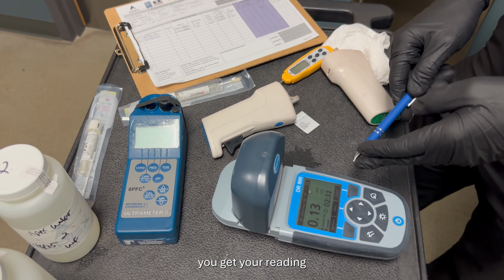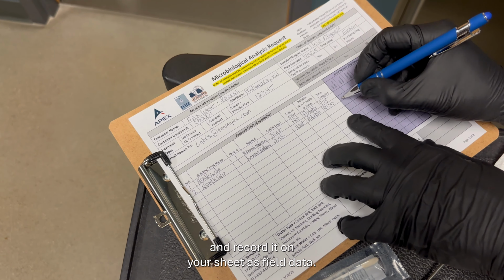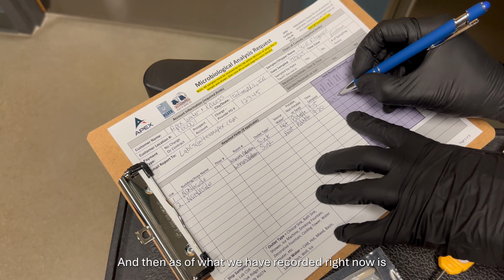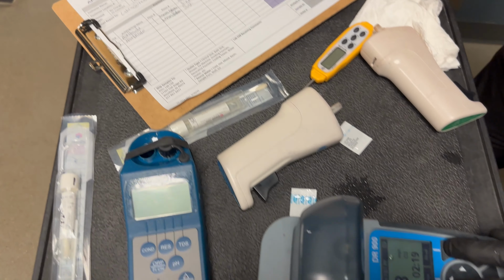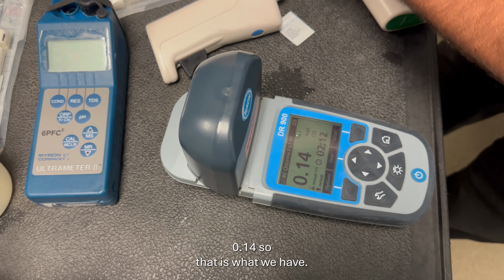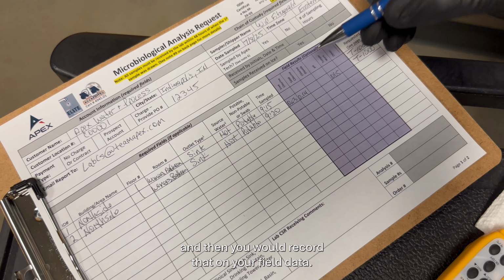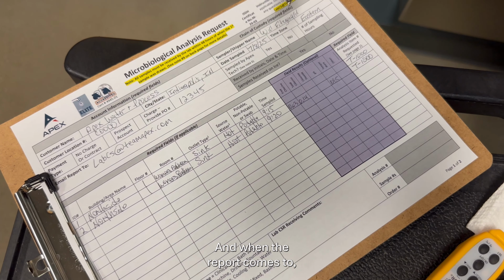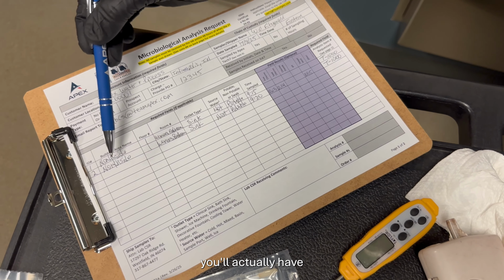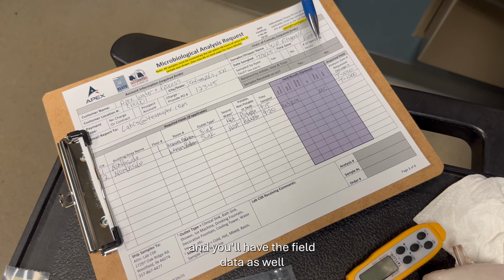And then once you get your reading from there, you would come over here and record it on your sheet as field data. So we had already had 0.03 on the free, and what we have recorded right now is 0.14. Let's just assume that is after 3 minutes. And then you would record that on your field data. When the report comes back to you, you'll actually have the full name on here, all these details, and you'll have the field data as well on your report.